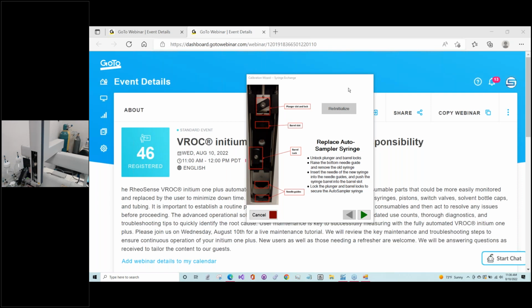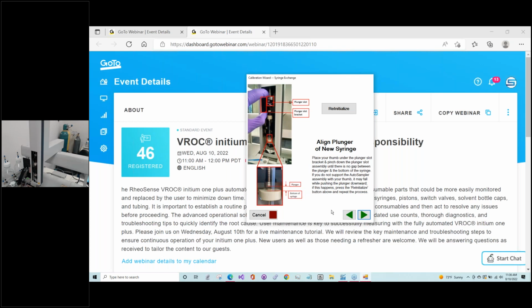Okay, so if you don't remember everything that Marina just did, you'll notice if you use this wizard, it basically points out and highlights every piece that you need to rotate to reposition that syringe once it's back in place. So then we step through this, and the next step is, of course, to make sure you pinch this. This is basically pinching the plunger and the plunger block there. That gets the piston in the right place. So if you've replaced your test syringe and or your piston, and you immediately afterwards have loading issues, then you might want to come back and repeat this step, because sometimes not doing this properly can be an issue for loading, even if you have a brand new component.